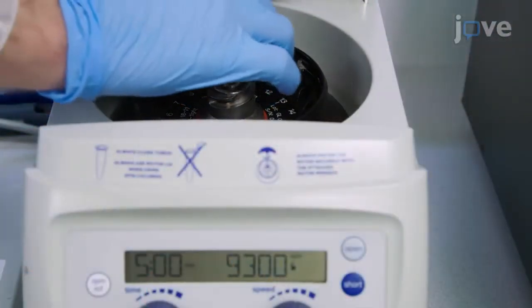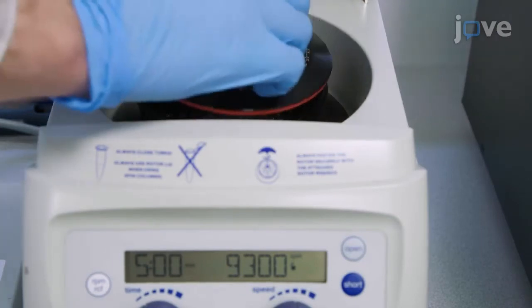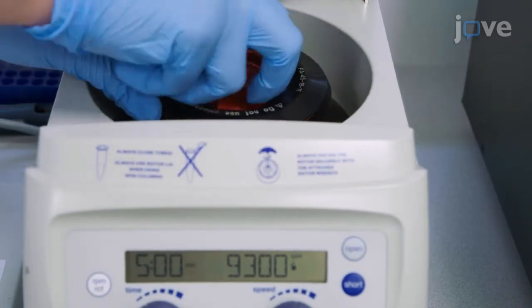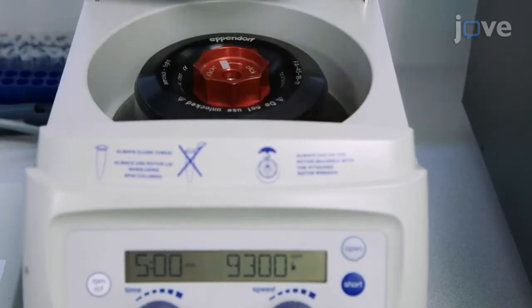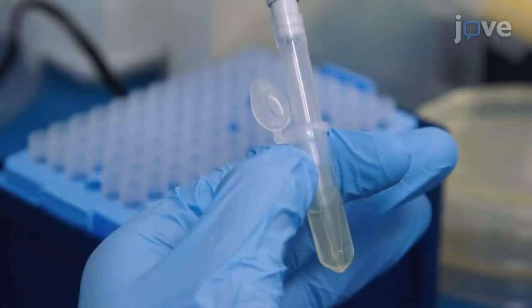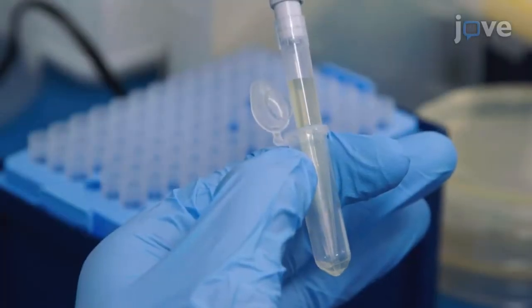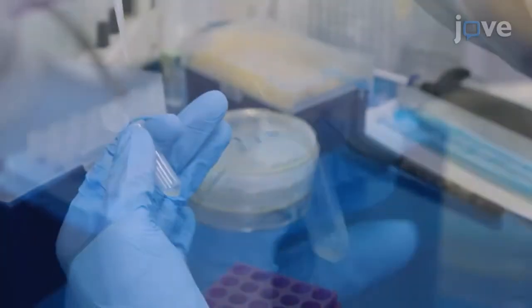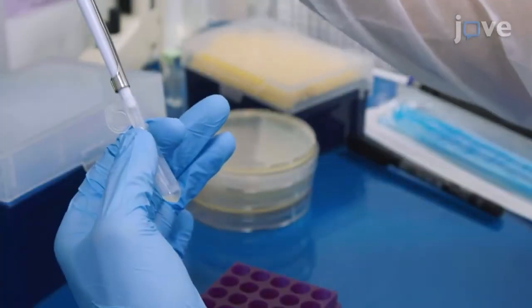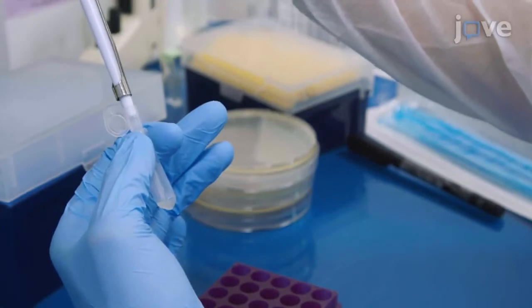Centrifuge the tube for 5 minutes at 9,300 times G to pellet the bacteria, then discard the supernatant, and re-suspend the pellet in 50 microliters of LB.